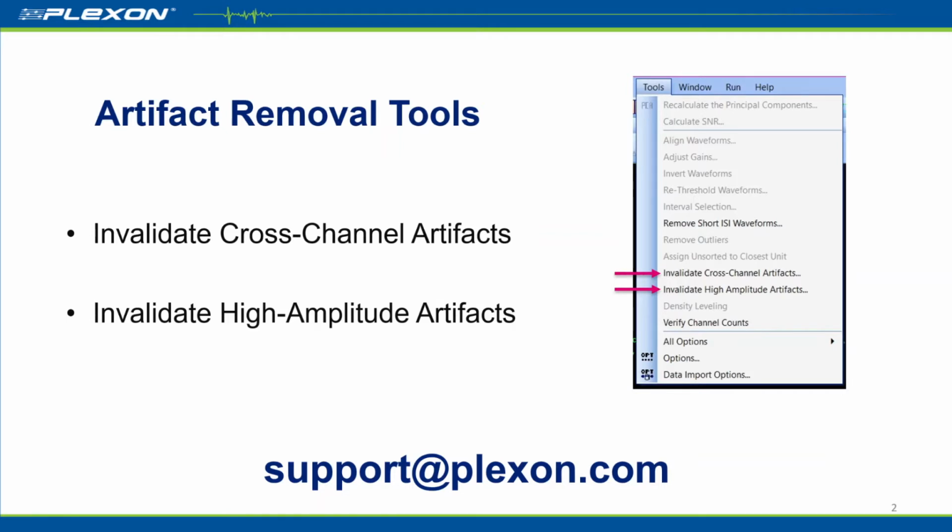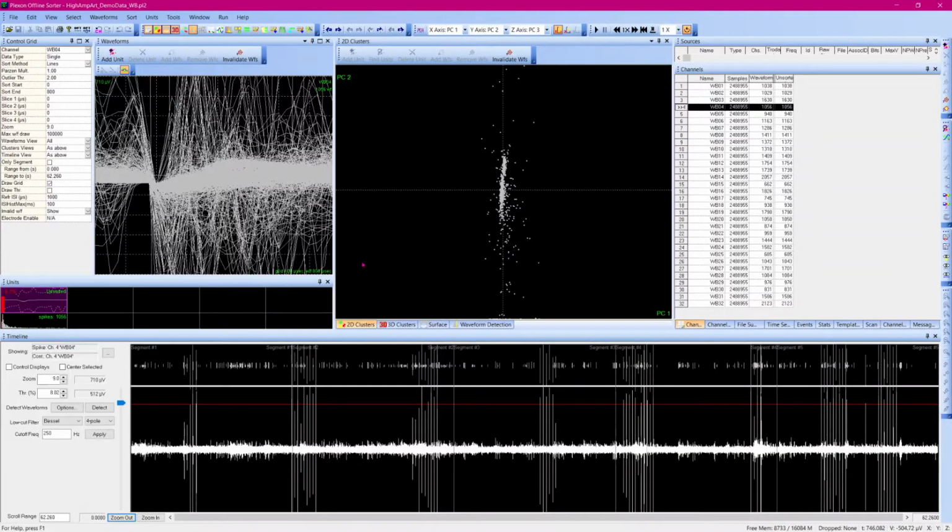These tools are for invalidating waveforms and will not modify continuous data. Let's start by looking at a file that has a clear artifact. These data are waveforms that were detected from a filtered wideband signal, but have not yet been saved into a new file, which is why I see the stacked waveform and continuous data streams in the timeline view. This is for illustration purposes only. You should save your files often.